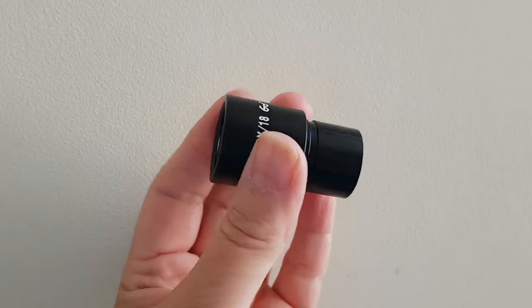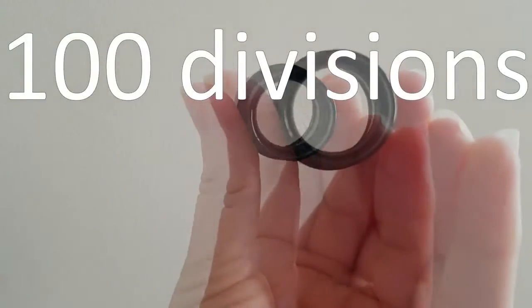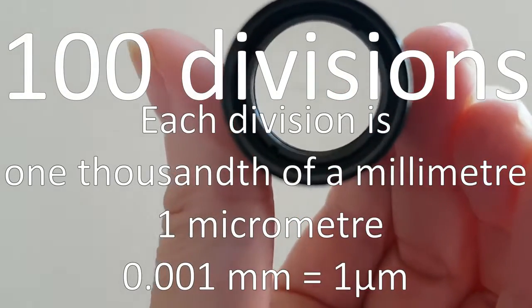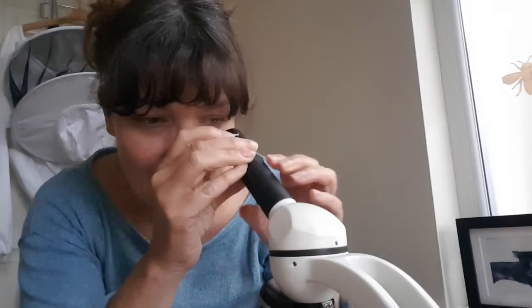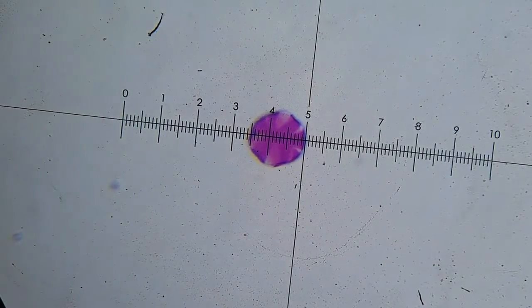There's only one way we can try to identify it, and that is by using a micrometer. Each division is 1/1000th of a millimetre. Let me show you what it looks like with the ocular micrometer. So that's about 16 divisions.